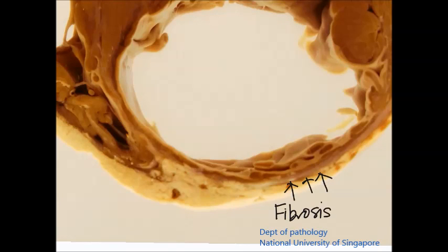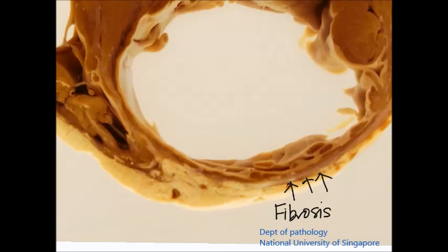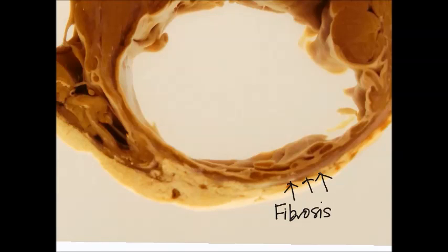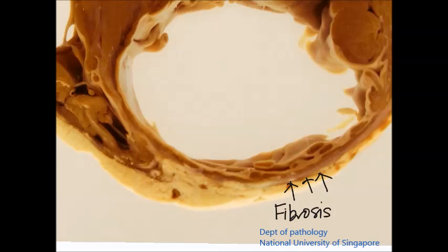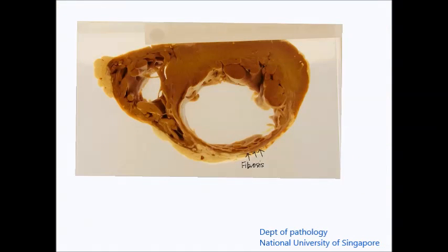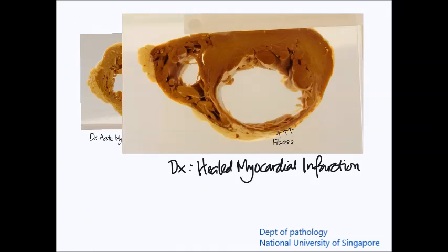This represents fibrosis. Fibrosis occurs as part of the healing process that replaces dead tissue in which the cells are not able to regenerate. Myocardial tissue is one of these tissue types, and when there is previous loss of cardiomyocytes or myocardial tissue, there is healing by fibrosis. This explains the marked thinning of the ventricular wall and the greyish-whitish areas. The diagnosis in this instance is therefore healed myocardial infarction.